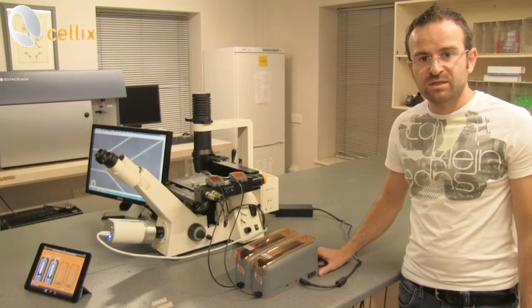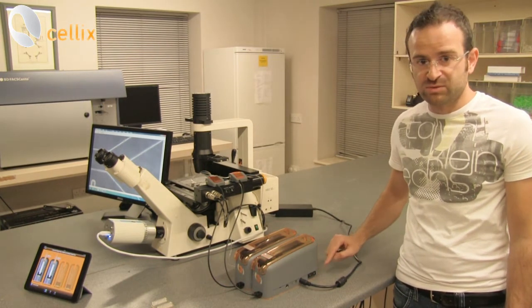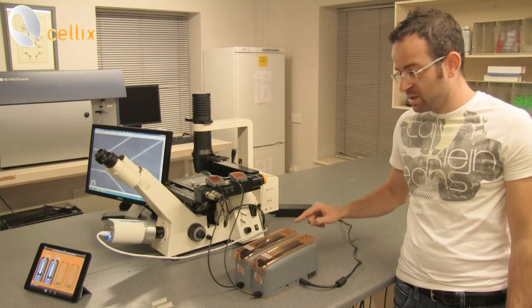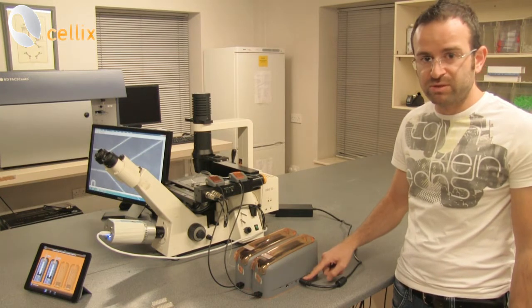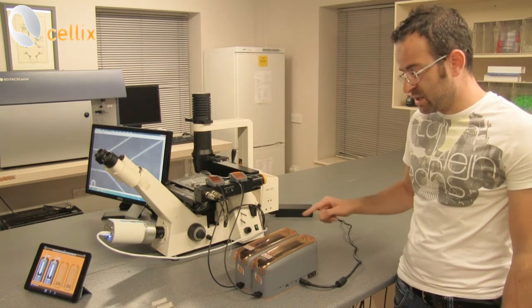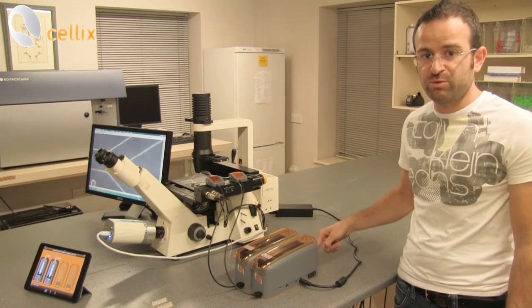The Exigo pumps can be stacked together up to a maximum of four pumps. In this specific case we are using just two pumps. On this side there is the cable of the power supply and the second pump is powered by the connector which connects the two pumps together.